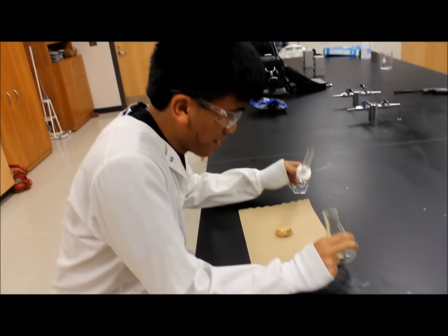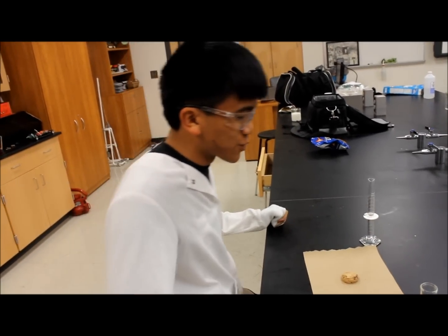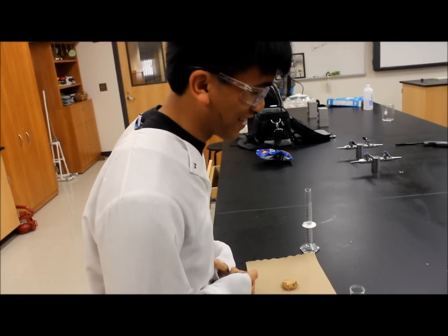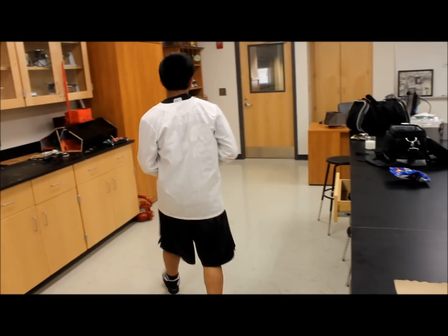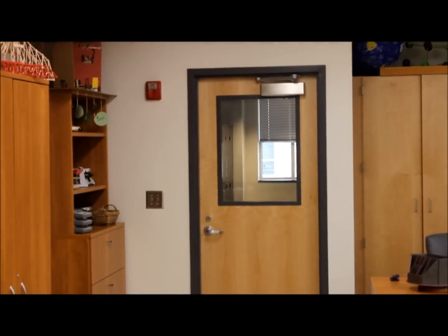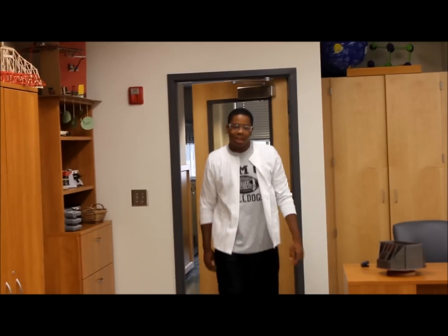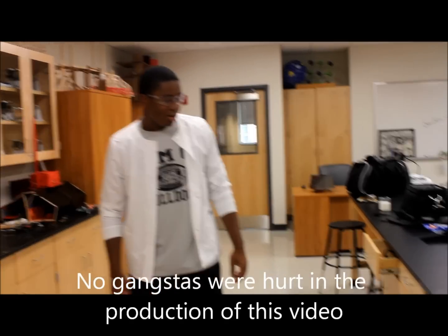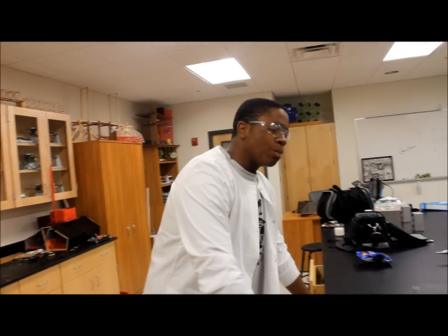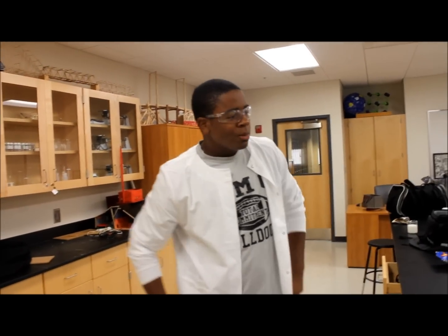Rule number two, no eating in the lab. Yes, I've done it. Made the first radioactive cookie in the world. It causes diabetes, anal leakage, so much other bad things. But I'm not hungry today. I'm not gonna eat it. Cooking good, man. And that's why, do not eat in the lab.